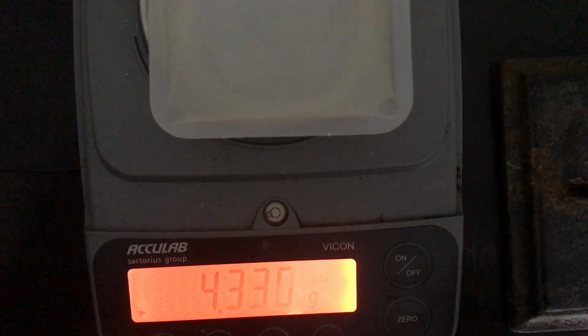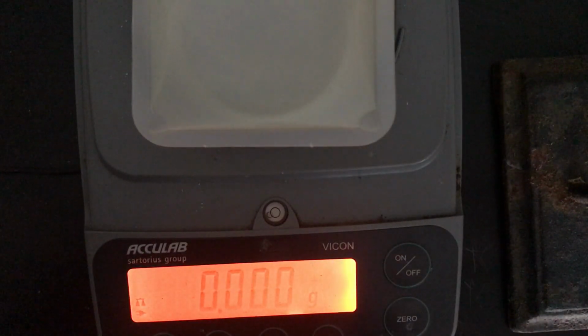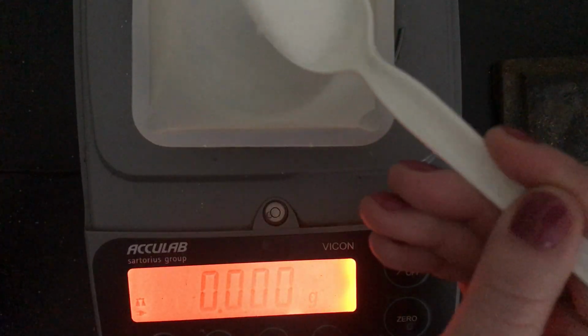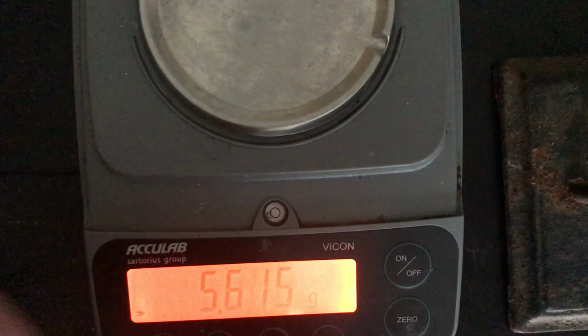All right, so I'm putting my weigh boat onto the balance here, I'm going to put 1 teaspoon of sodium chloride into the weigh boat. Oh wait, hold on. Before we do that, we need to hit 0 so we don't accidentally include the mass of the weigh boat. There we go. So mass of the weigh boat is now 0, adding in 1 teaspoon of sodium chloride. And there is our mass. Mark that down for the mass of 1 teaspoon of sodium chloride.